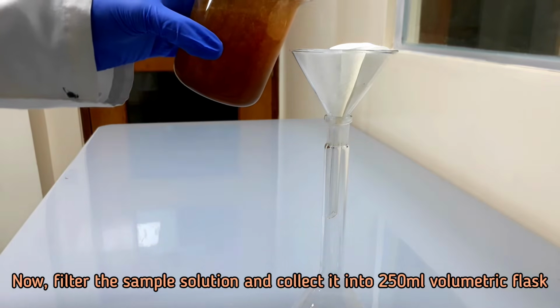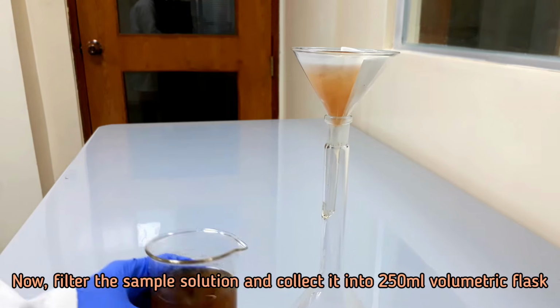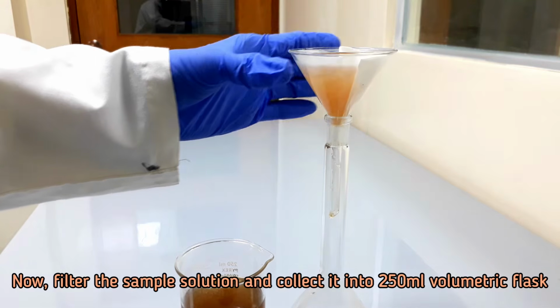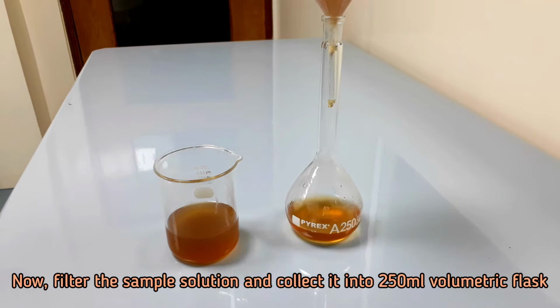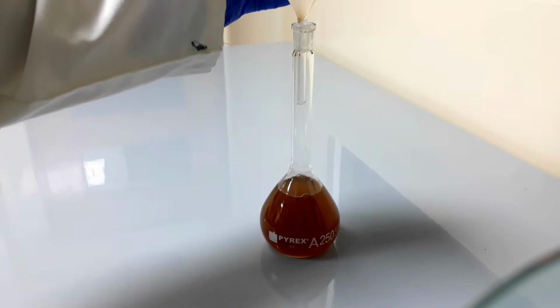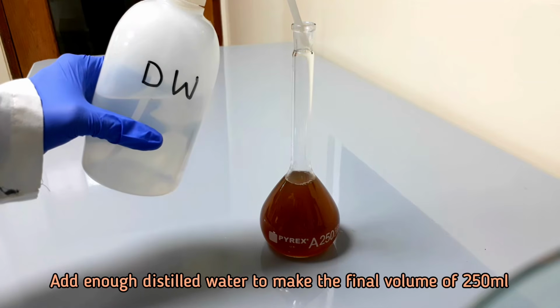Filter the sample solution and collect it into a 250 ml volumetric flask. Add enough distilled water to make the final volume of 250 ml.